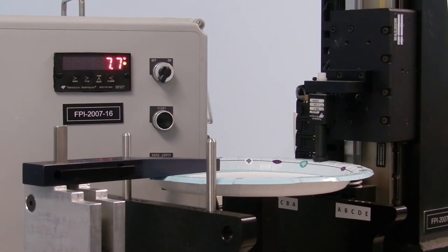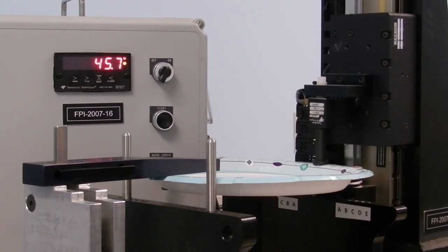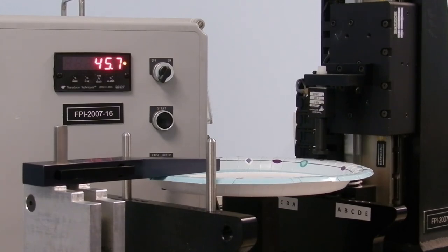The same methods for positioning and stabilizing the plate are used. Pressure is again applied to the right side of the plate until it's deflected a half an inch. The pressure reading is recorded. In this case, 45.7 grams of force was needed to deflect the plate a half an inch.